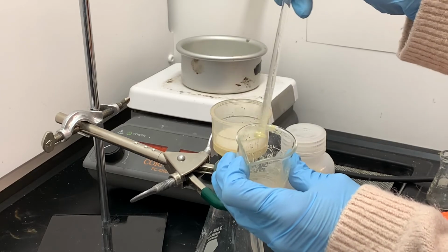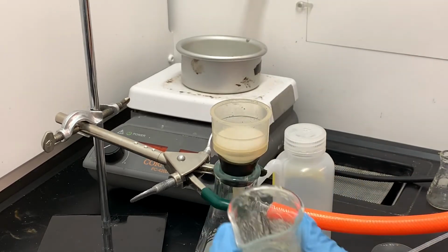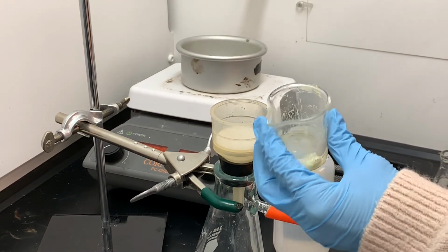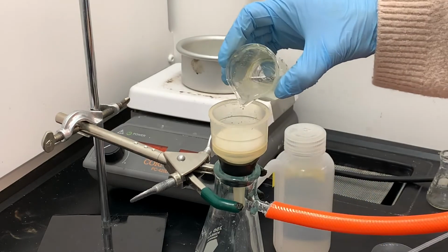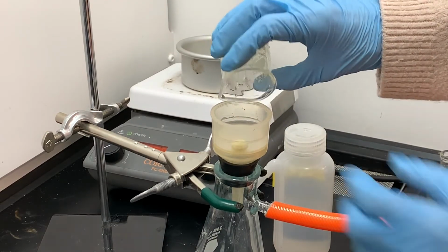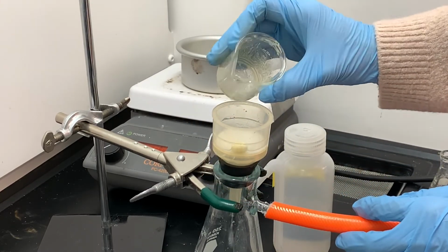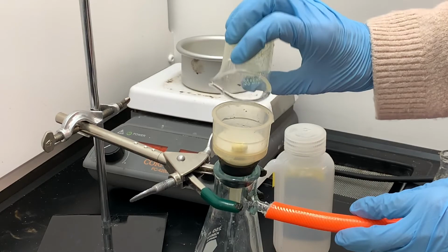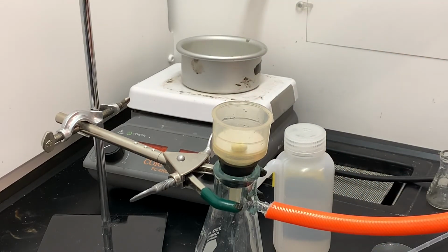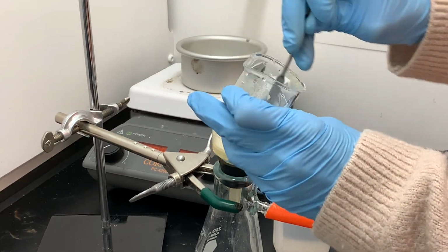And then in this filtration process, I am just getting rid of the water and the other aqueous byproducts, and I'm leaving my actual product stuck to the inside of this flask or beaker. So you'll see that I'm not going to try to scrape any of that stuff out into the funnel. I'm just going to go ahead and let it sit inside the beaker. And again, all of that yellow gooey stuff stuck to the inside of the beaker, that's actually the product of this reaction.